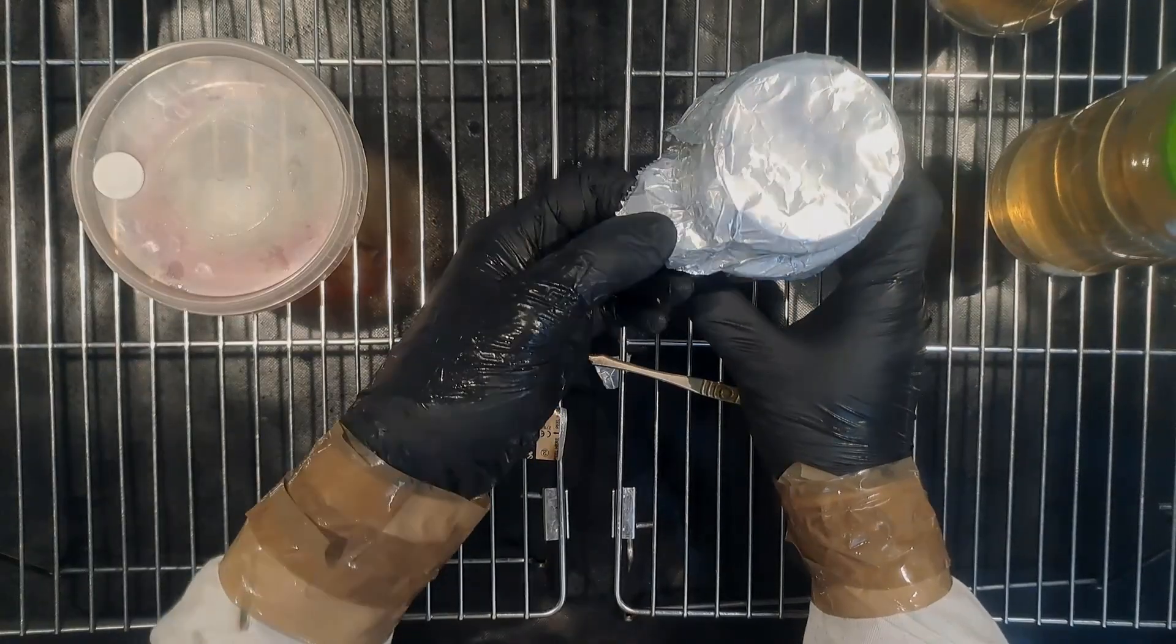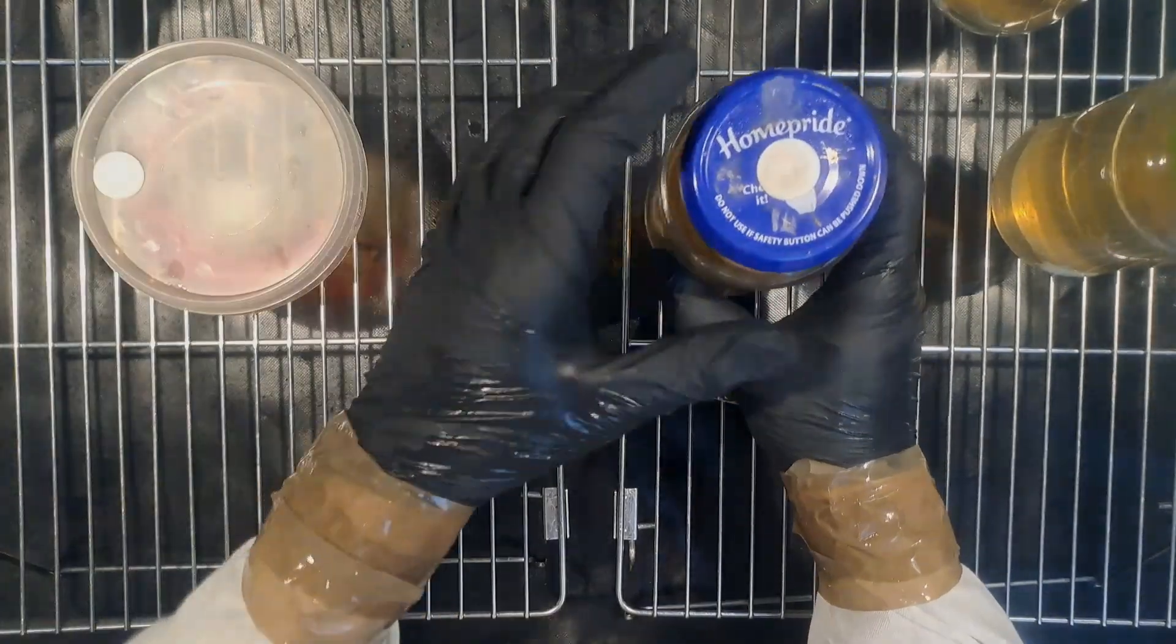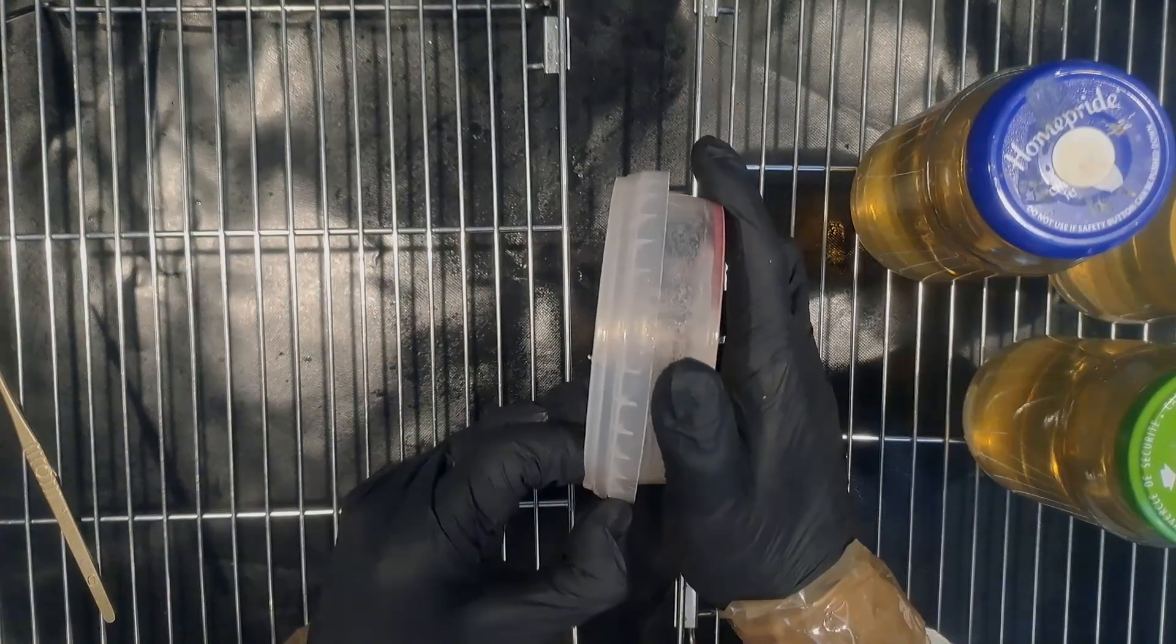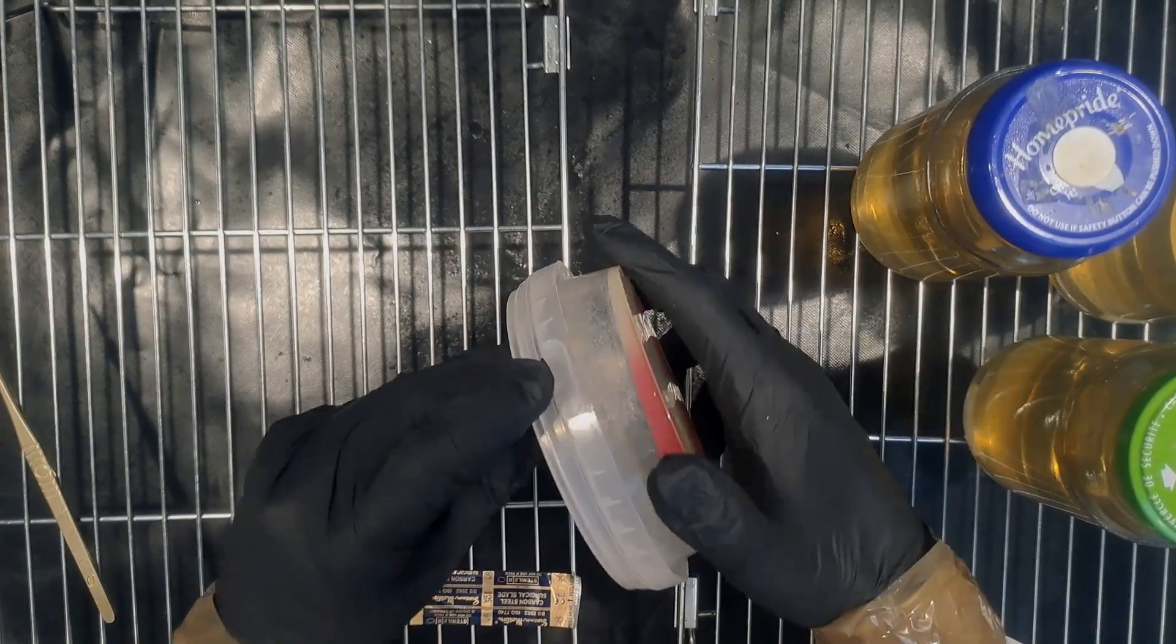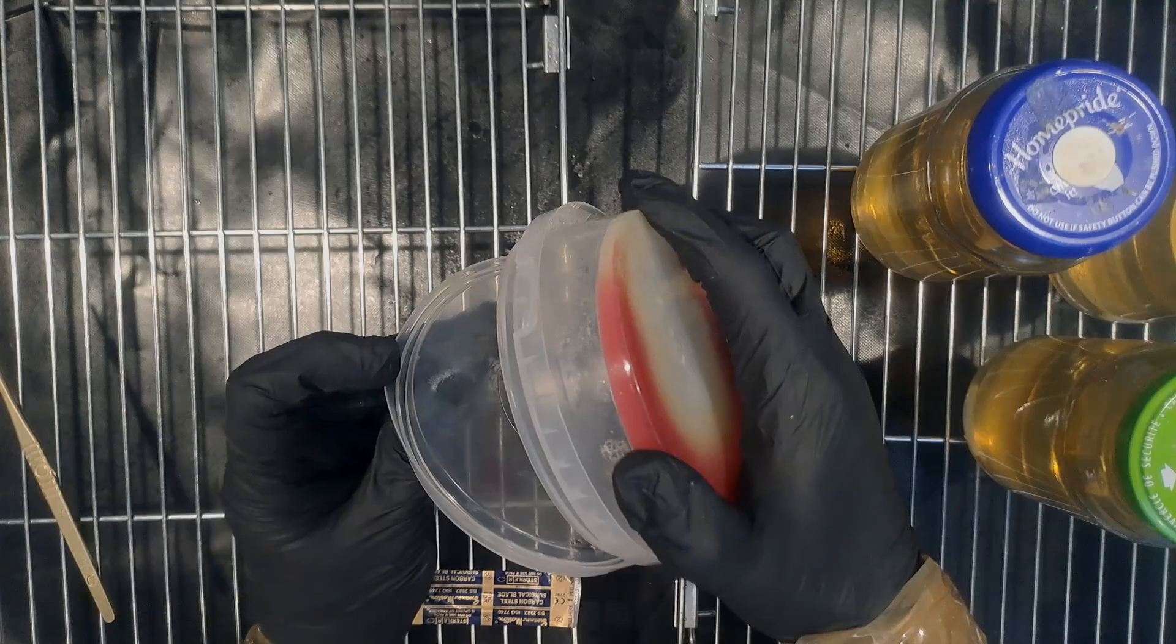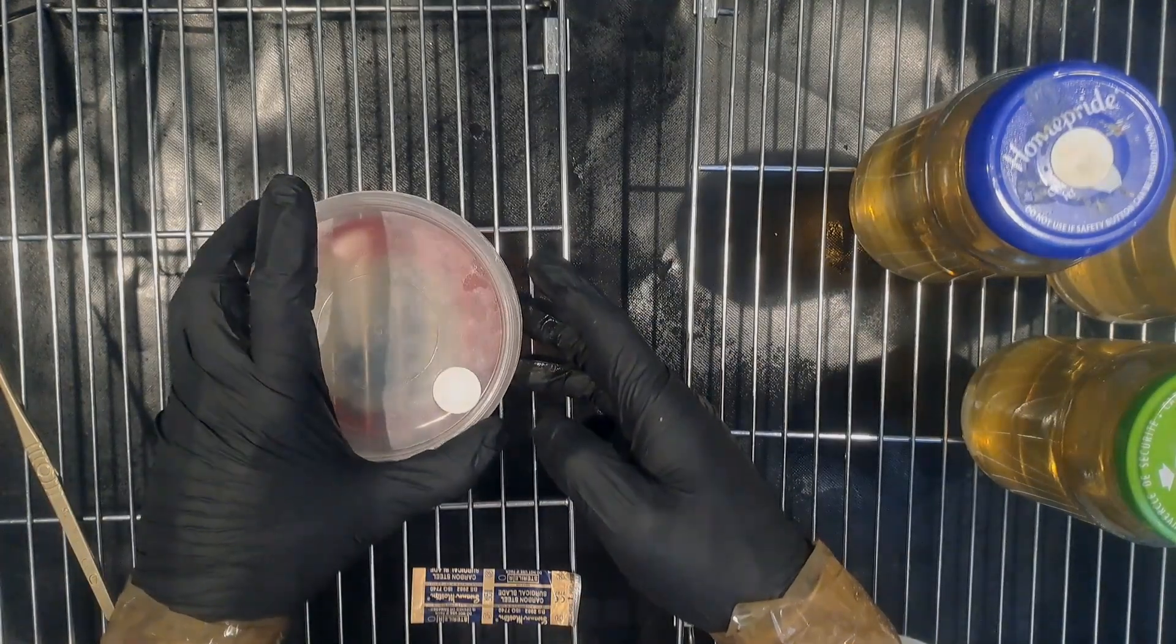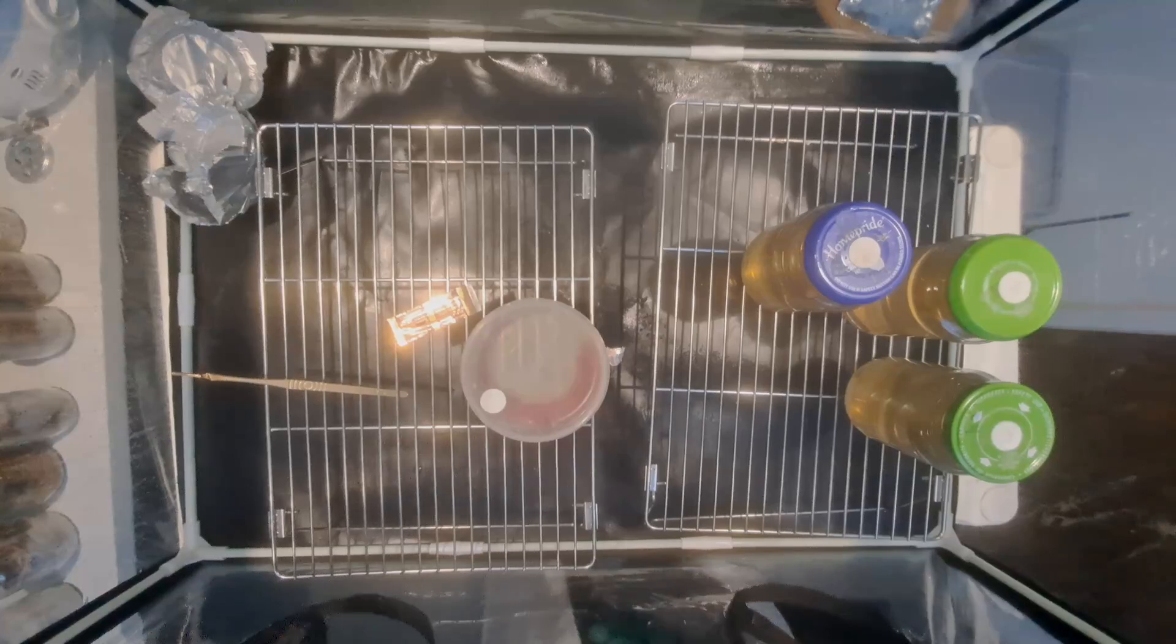Take the foil off the top, loosen all the lids, organize the still air box, and finally assemble your scalpel.